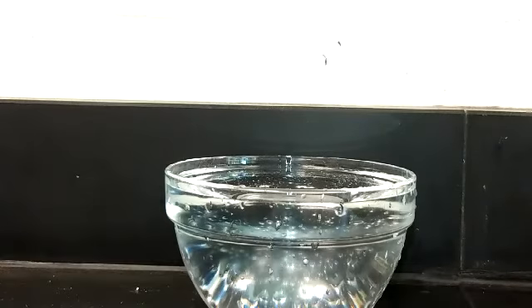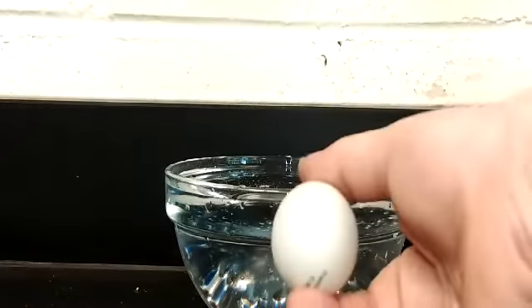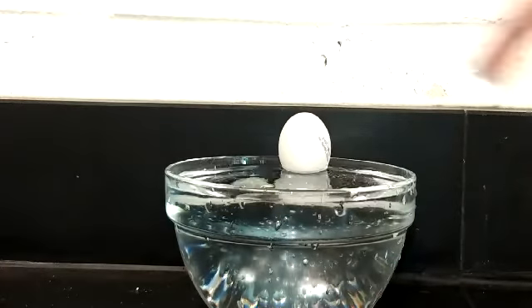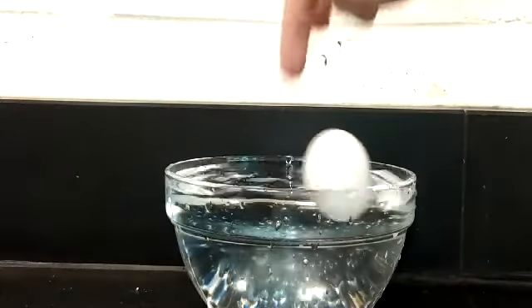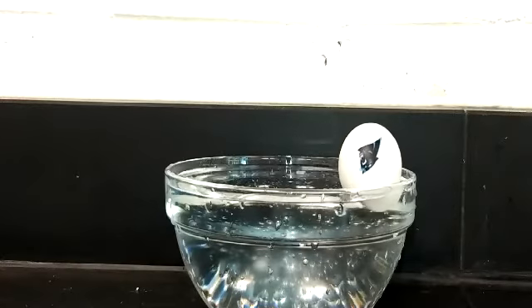This is a great method when you're measuring certain things, but it doesn't always work. Let's be real. There are a few things that this might not work for. There are certain things you just don't want to stick in water. I'm not going to use water displacement to figure out the volume of my phone. That would be a bad idea. And some objects, even if you are willing to get them wet, and they'll be fine if they get wet, well, they don't really go underwater. So that could be a problem too. So the water displacement method isn't always ideal.